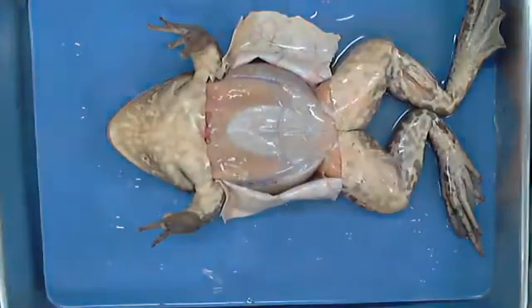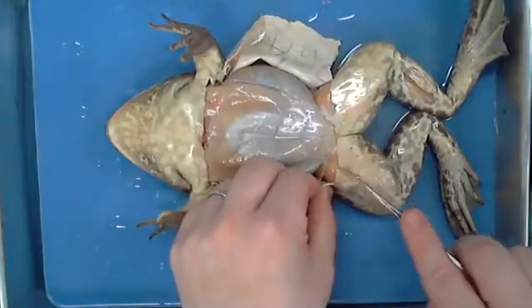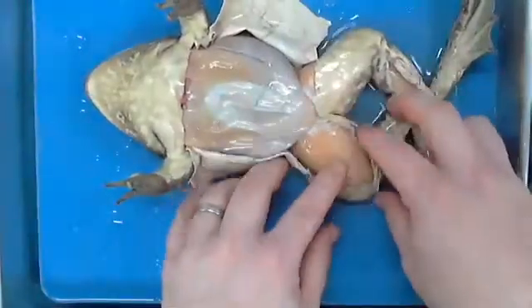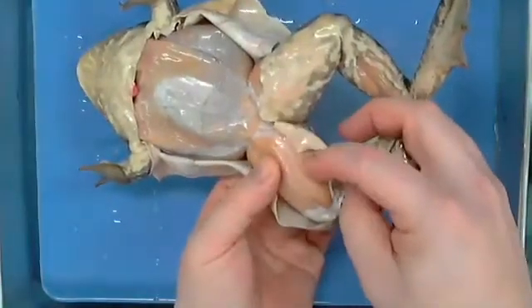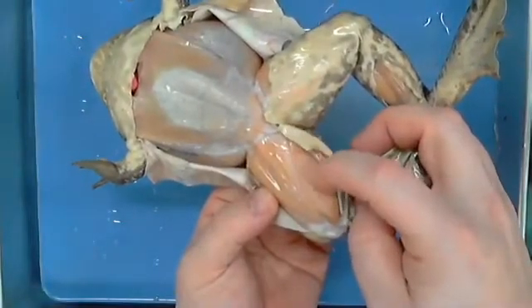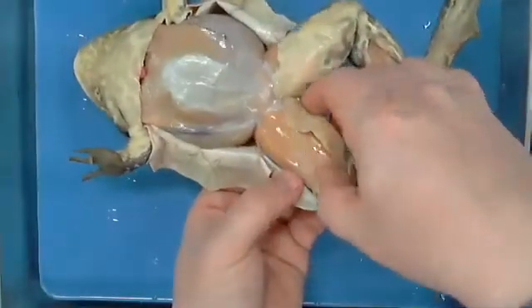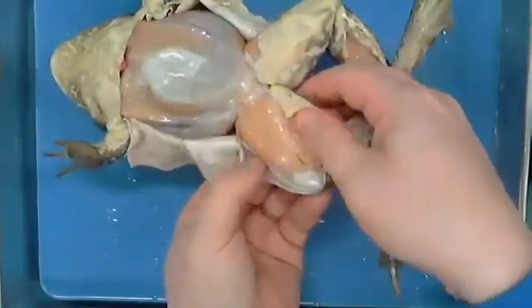As a matter of fact, I'll go ahead and show you, in this case, just like you would have expected to see with our musculature elsewhere, you will notice that there is a difference. I'm going to hold this up. So in this case, this inside muscle, which we know is a what? What do we call this? Flexor. All right, so this is a flexor. We're using this to bend the leg in. If you were to actually separate this, you could stick your fingers down between these layers and be able to pull this apart. And you would have a flexor.